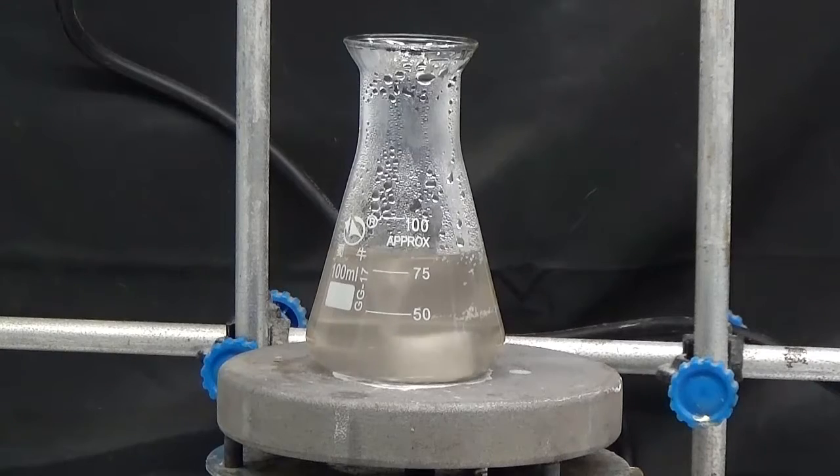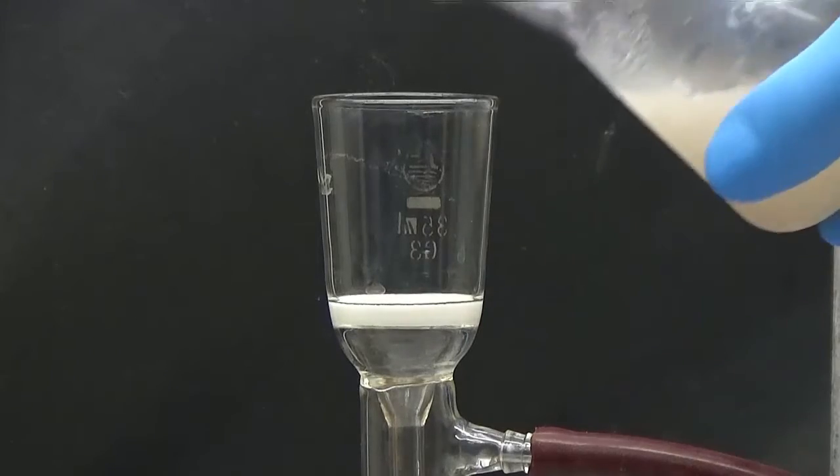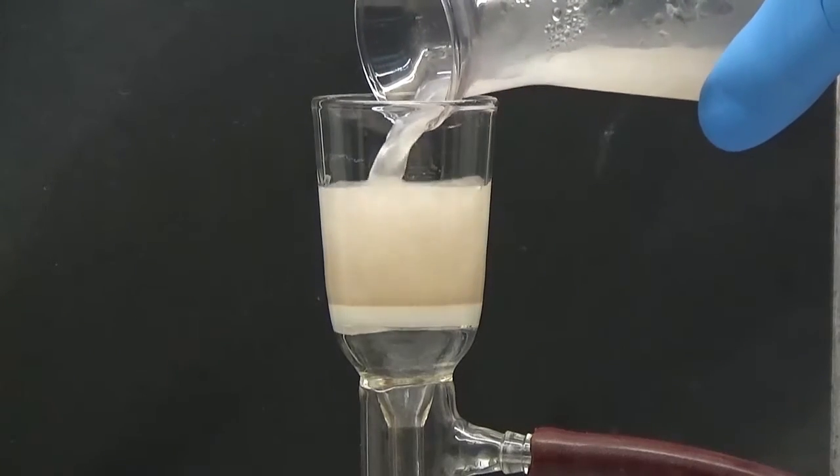Concentrate the solution to 50ml and let cool in the refrigerator. Collect the crystals by suction.